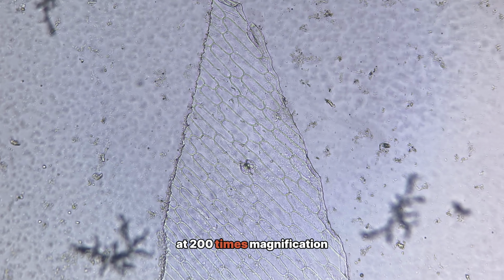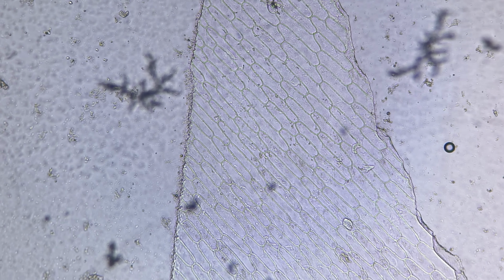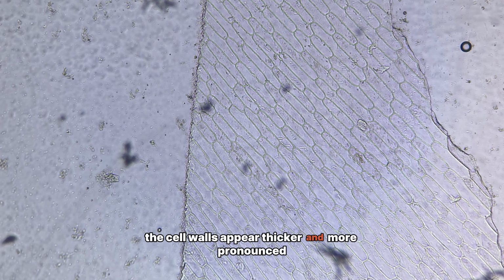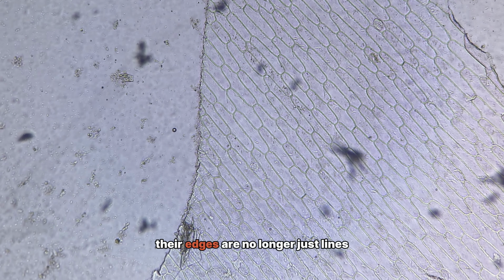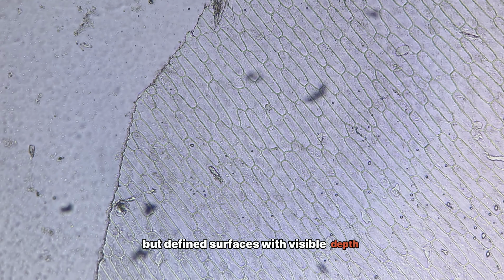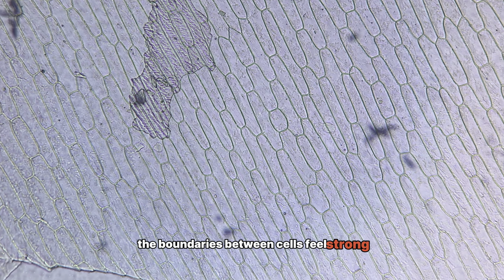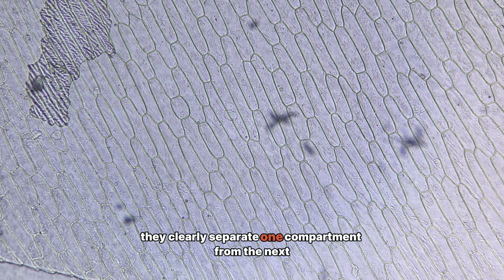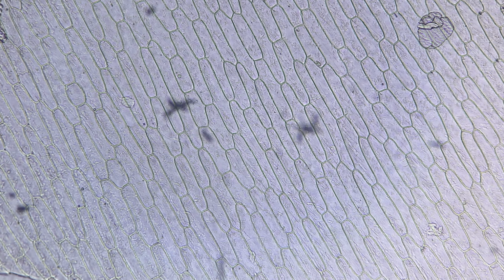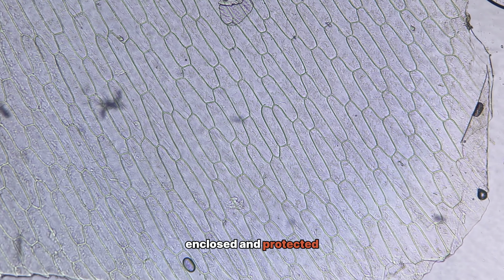At 200 times magnification, the onion structure becomes more expressive. The cell walls appear thicker and more pronounced. Their edges are no longer just lines, but defined surfaces with visible depth. The boundaries between cells feel strong. They clearly separate one compartment from the next. Each cell exists as its own space, enclosed and protected.